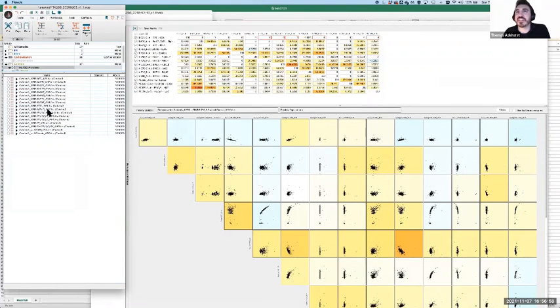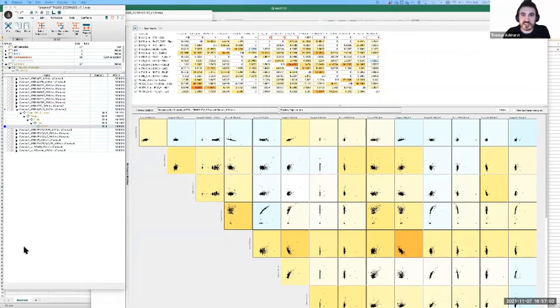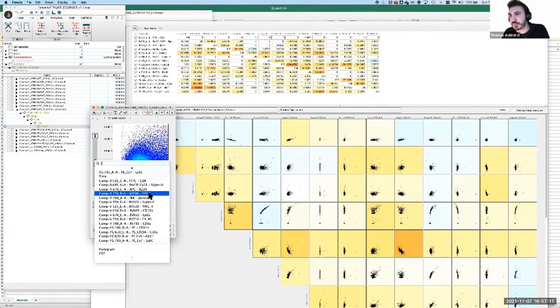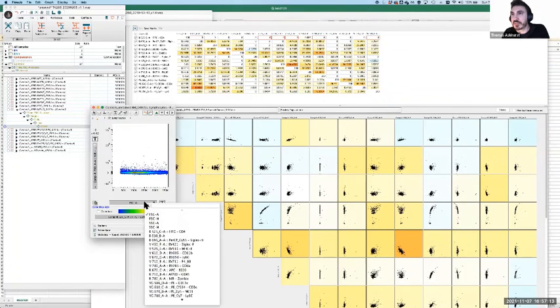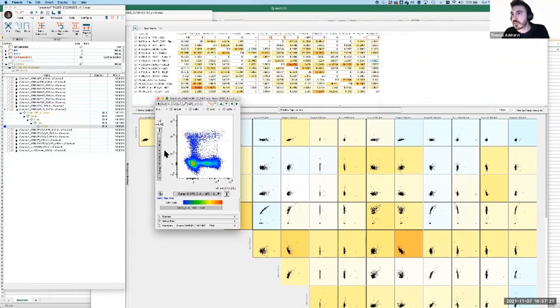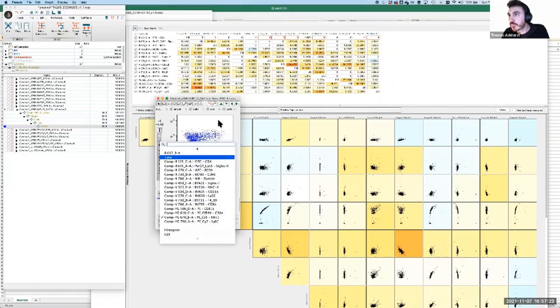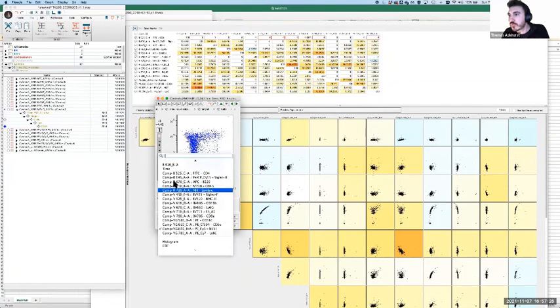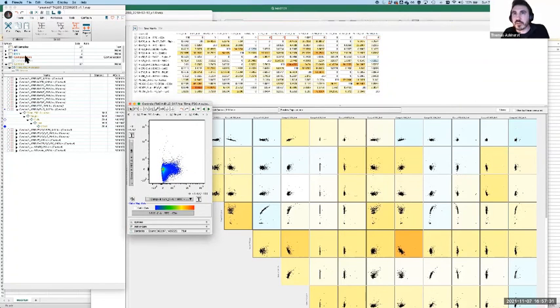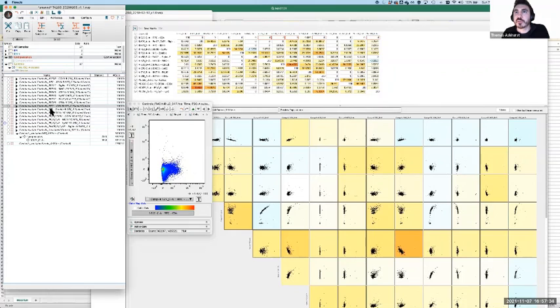Let me have a quick little check, make sure I haven't done something bad here. I realize one of the downsides of setting up things like this is that I mess around with it so much that when I come back to do the live demo, it's sort of a complete catastrophe, and it's like, well, I should probably do this differently. Oh, no, sorry. All right. Here it is. Live/dead. Zombie, FITC. No, sorry, that is an FMO. It's not going to help at all.